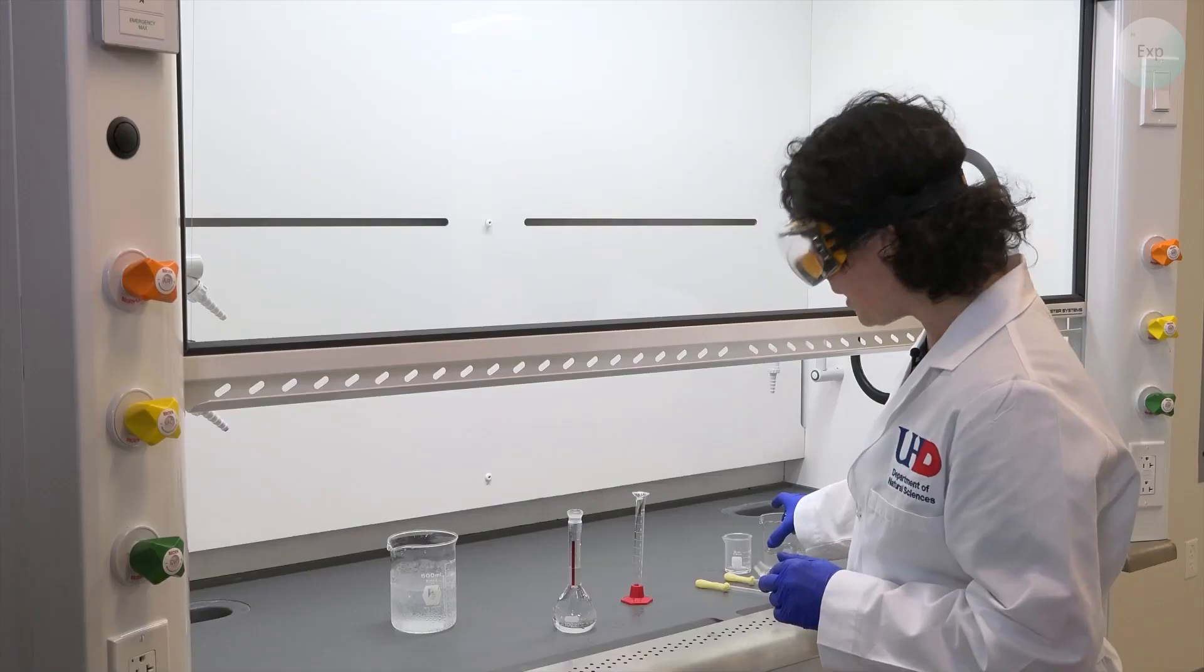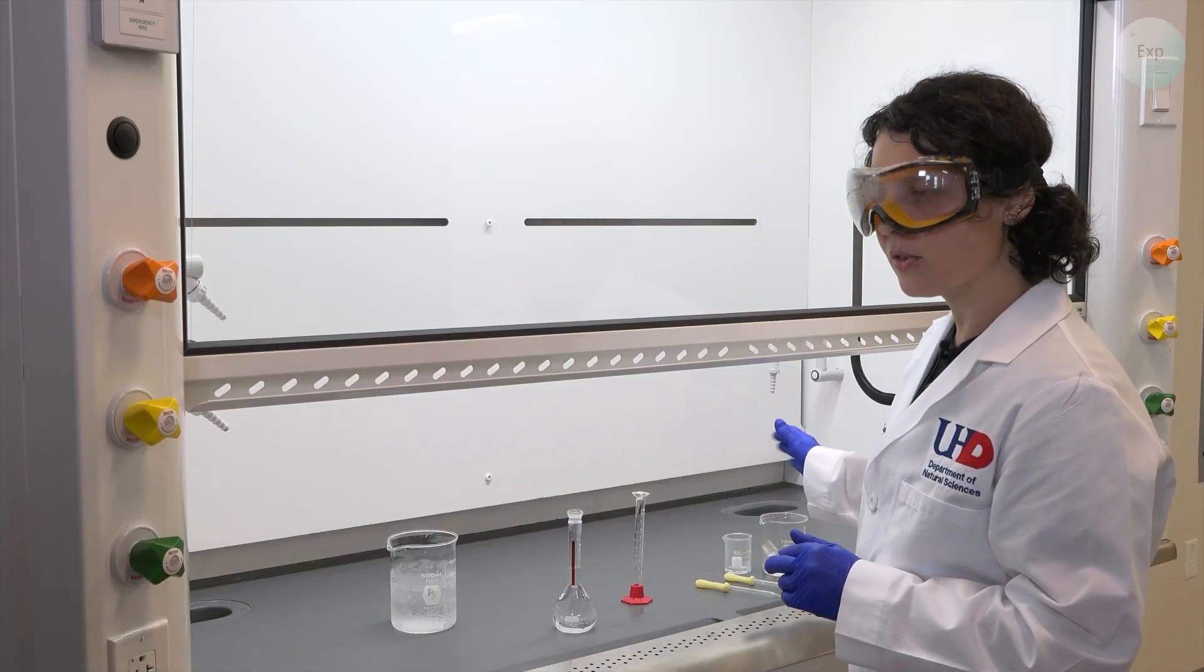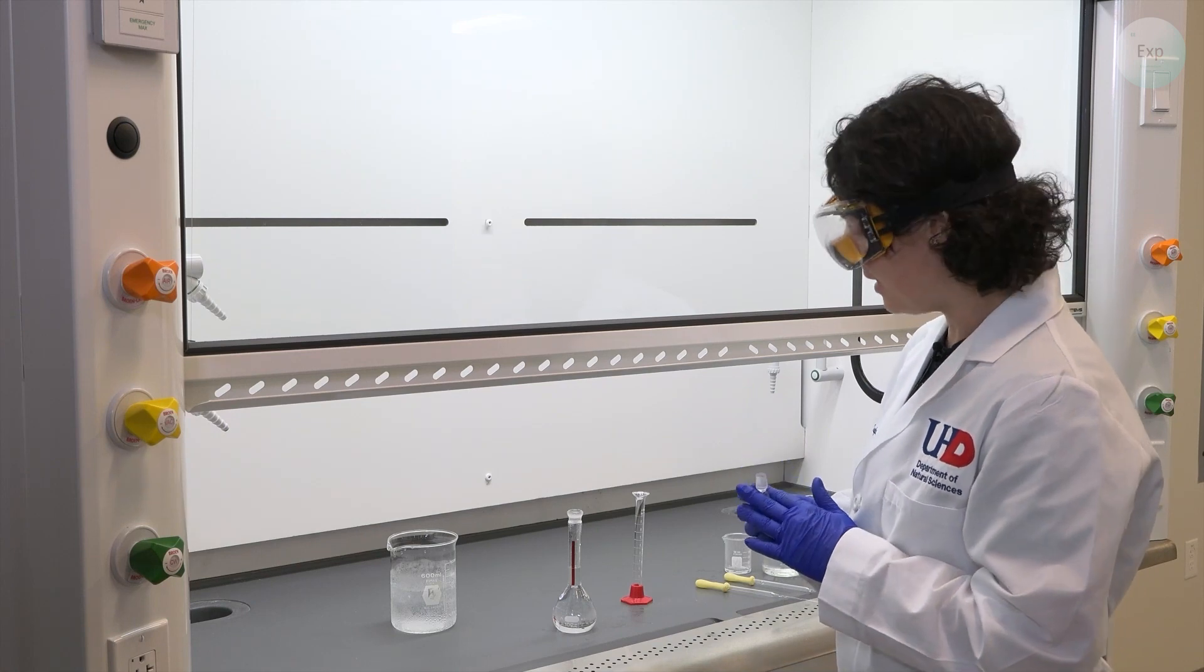From here, our water and our concentrated hydrochloric acid solution can be disposed of.